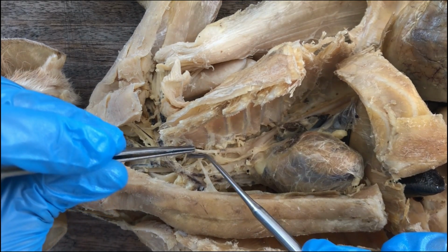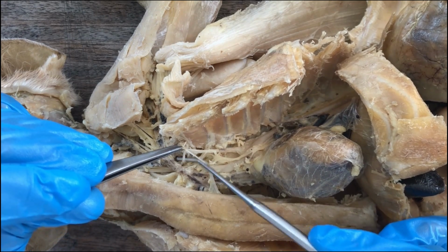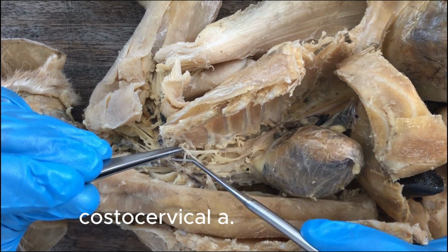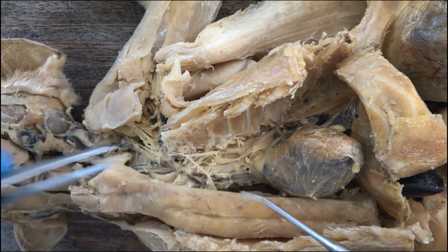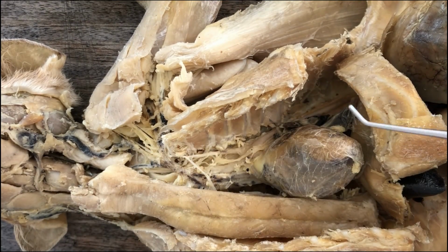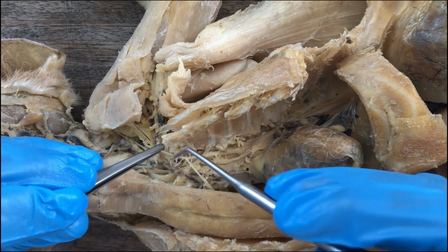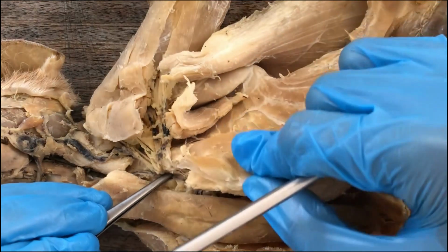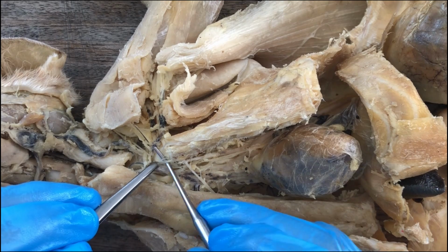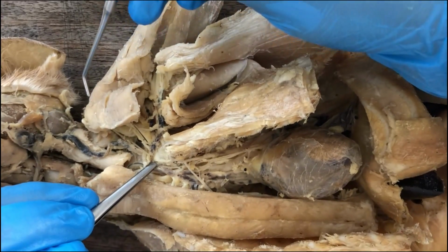And then if you just move more anteriorly, there's another branch there diving deep. It's the costocervical artery, supplying blood to the rib cage, for example, and also the deep neck muscles. And then just before the subclavian goes out of the thoracic cavity, it leaves off a branch towards the shoulders. If you trace it, it will be going to the shoulder.